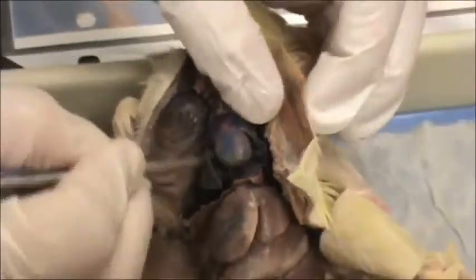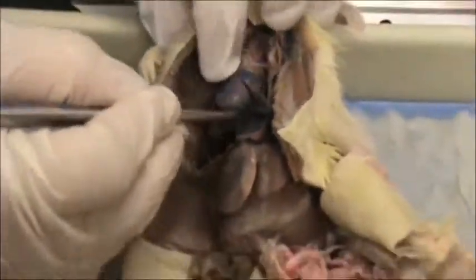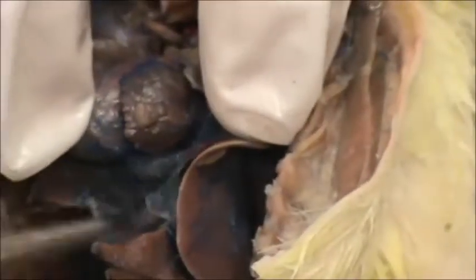The heart is surrounded by a membrane called the pericardium, and you can see some of it left over right here. That's the pericardium — it's a sac that encloses the heart.